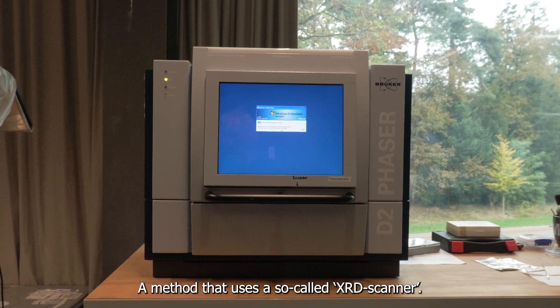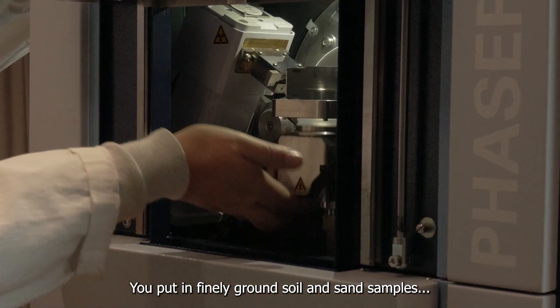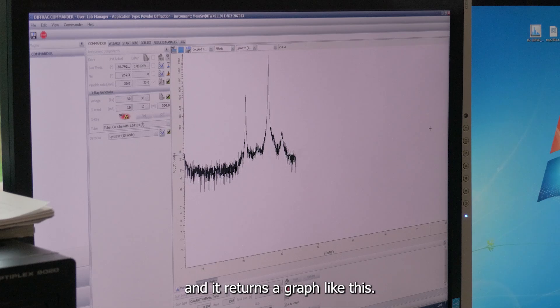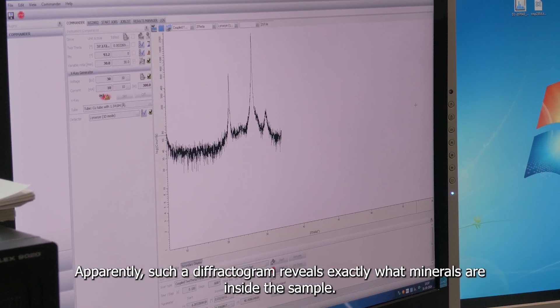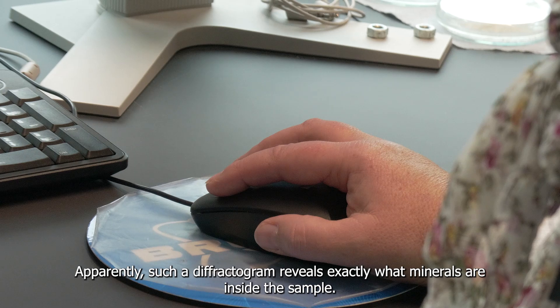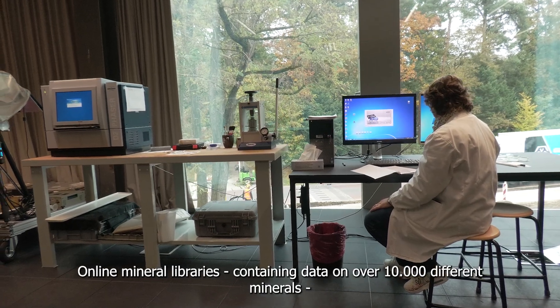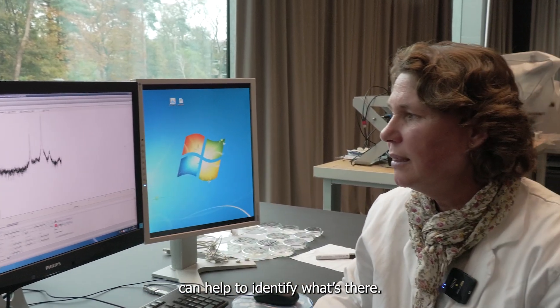A method that uses a so-called XRD scanner. You put in finely ground soil and sand samples, and it returns a graph like this. Such a diffractogram reveals exactly what minerals are inside the sample. Online mineral libraries containing data on over 10,000 different minerals can help to identify what's there.